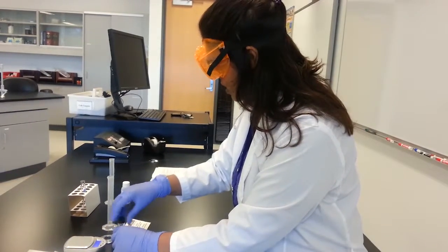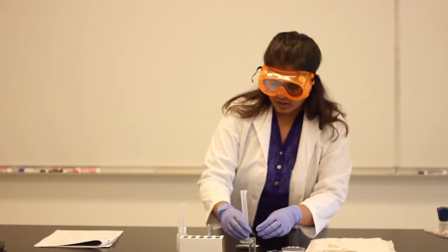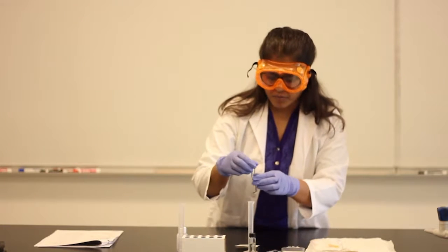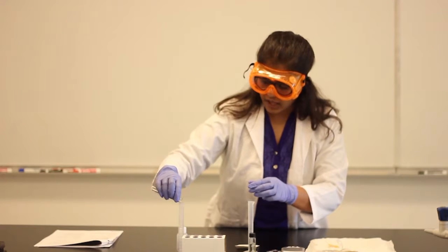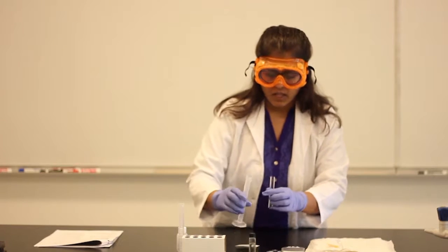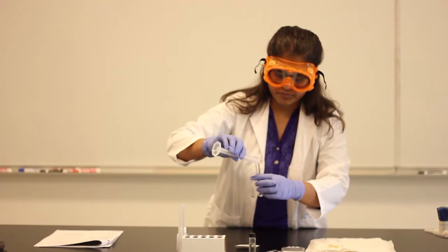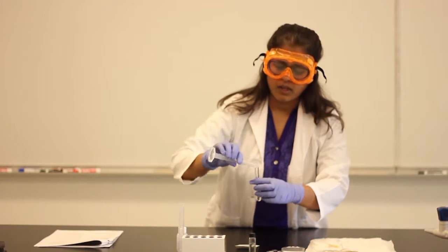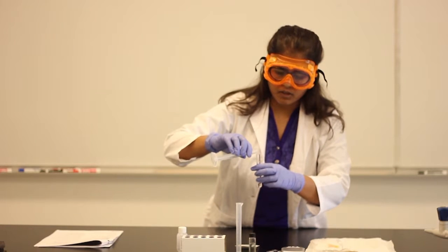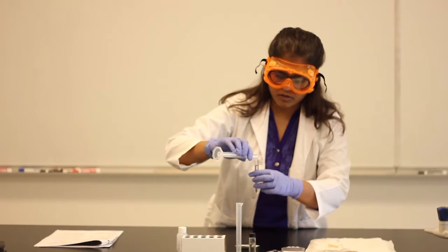Then what else can we do? We can see this biodiesel mixing with methanol, what would be the reaction? So I have here about 7 ml of methanol. Let's take this 1 ml of the biodiesel and let's see, mixing with methanol, does it form any other layer or not?